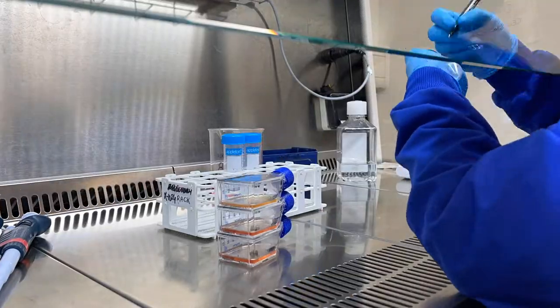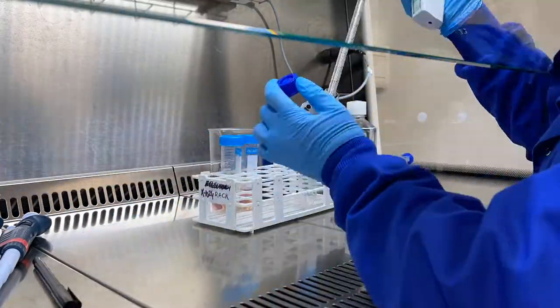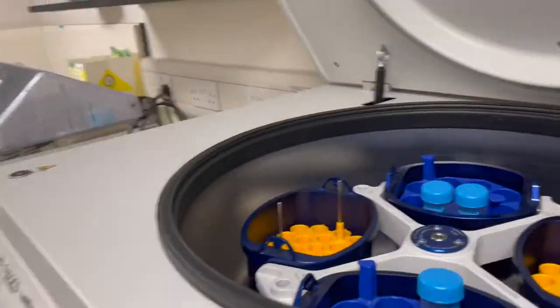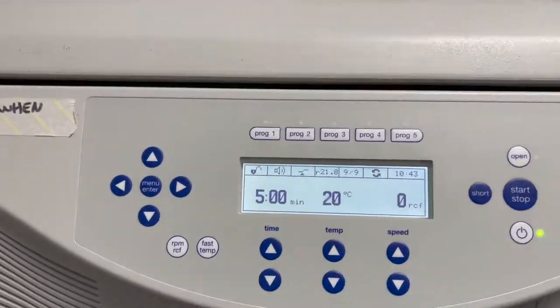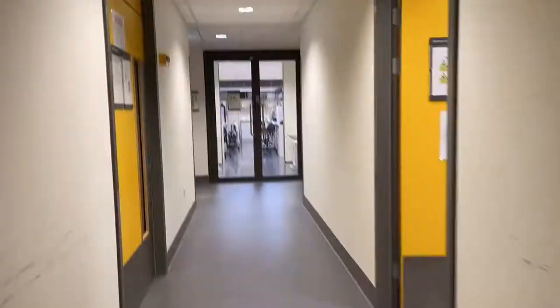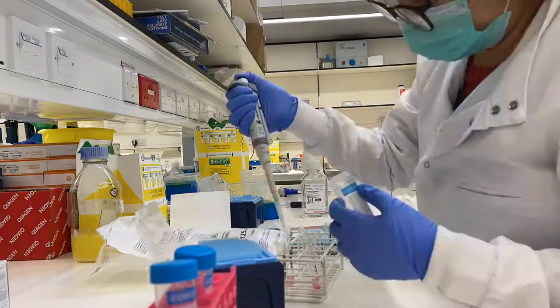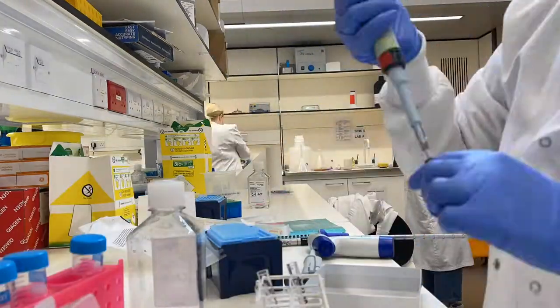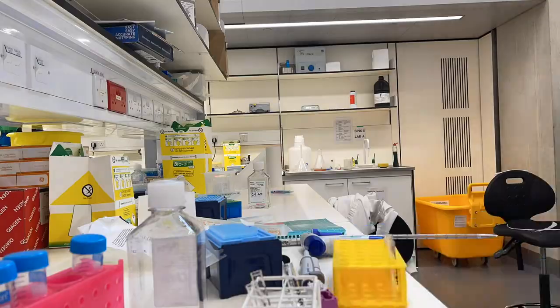The first thing I'm doing here is getting some cells that I have engineered to express a protein. I'll be using a technique known as flow cytometry to actually measure expression of the protein that these cells are expressing. I then head over to the main lab where I start the process of staining these cells with the antibody that allows me to measure the expression of this protein I'm interested in.